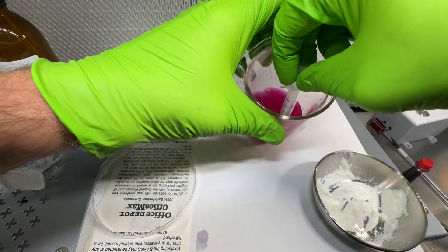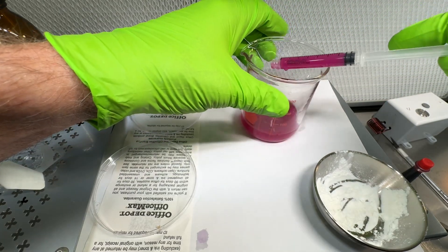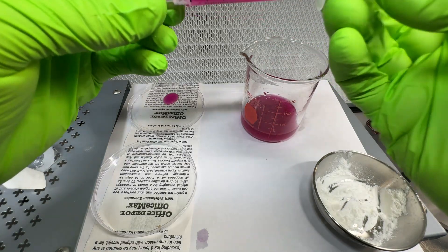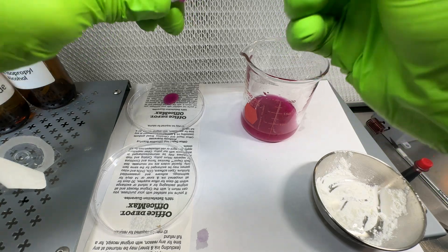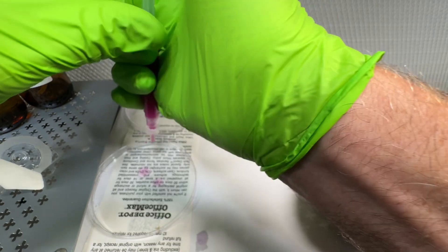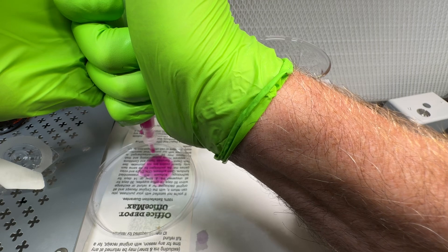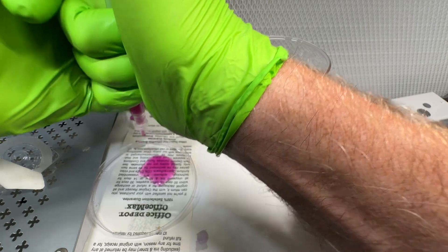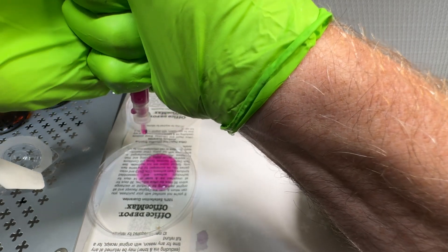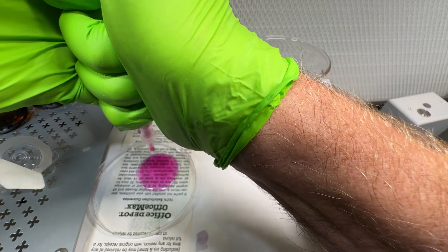Now I'm going to draw that up — a full three milliliters of the cloudy stuff — then put the filter on and see what we get. That's working perfectly. As you can see, we're getting all the cloudiness out and it is crystal clear again.